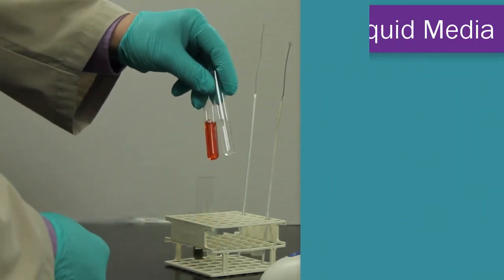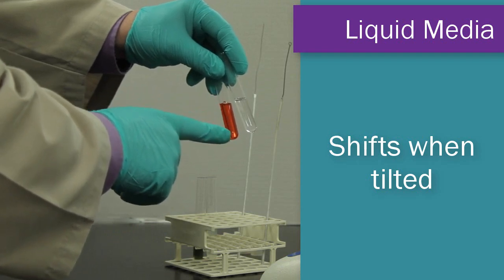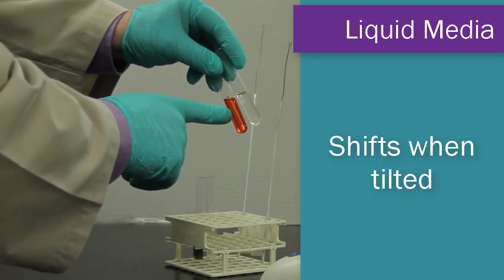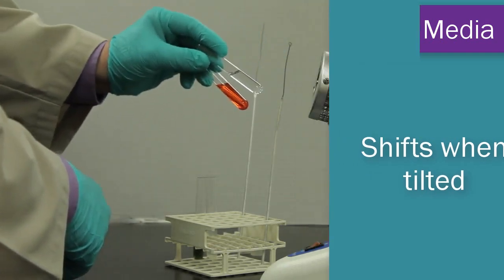These two examples that I have here are both liquid medias. Notice one of them is clear, one of them is red and also has a Durham tube inside, but when I tilt the tube sideways, you can see they're clearly liquid medias.